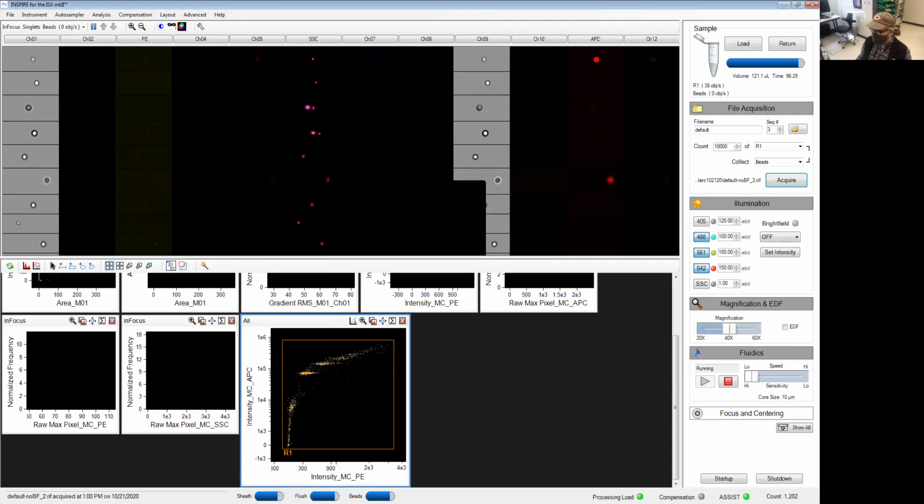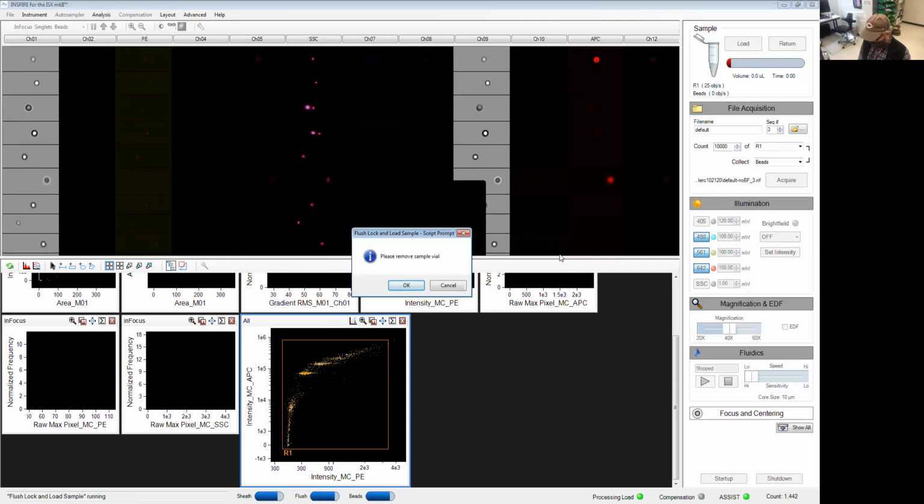Once you're satisfied with the way things look and you're ready to go, you simply can turn off the instrument if you're the last one in the day. Gonna take the sample out. So at the end of your run of all the samples, you're asked to remove the sample vial, clean the probe, and then the software will bring the portal down again, and you'll be asked to run another sample. At that point, we'll just click cancel.